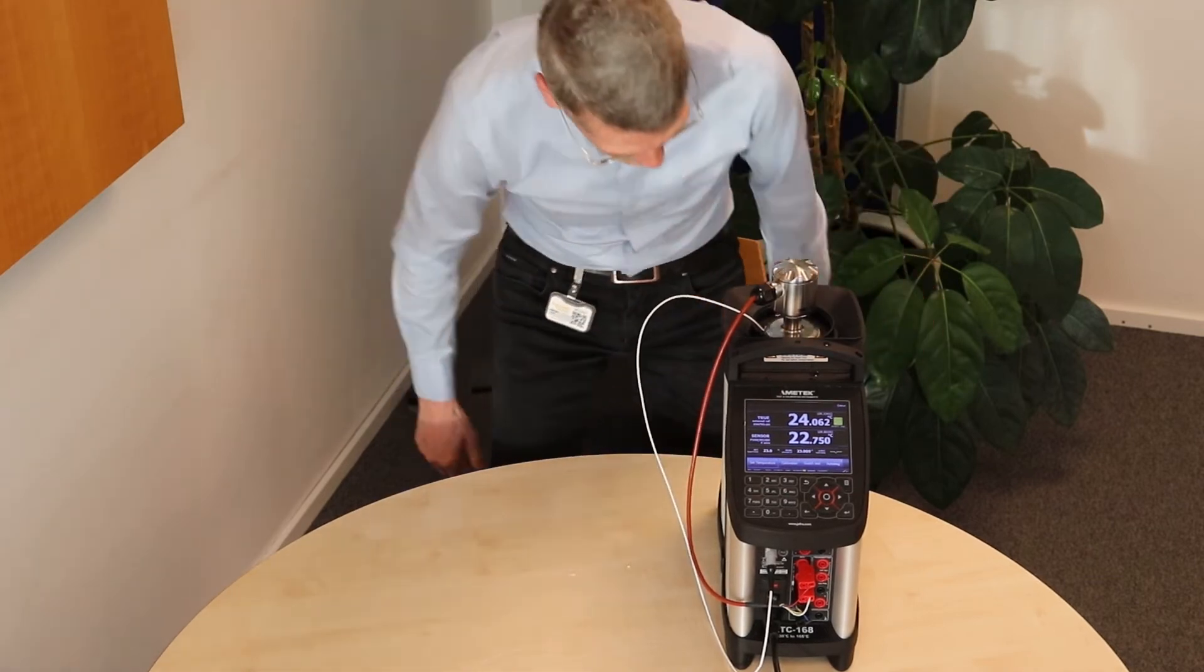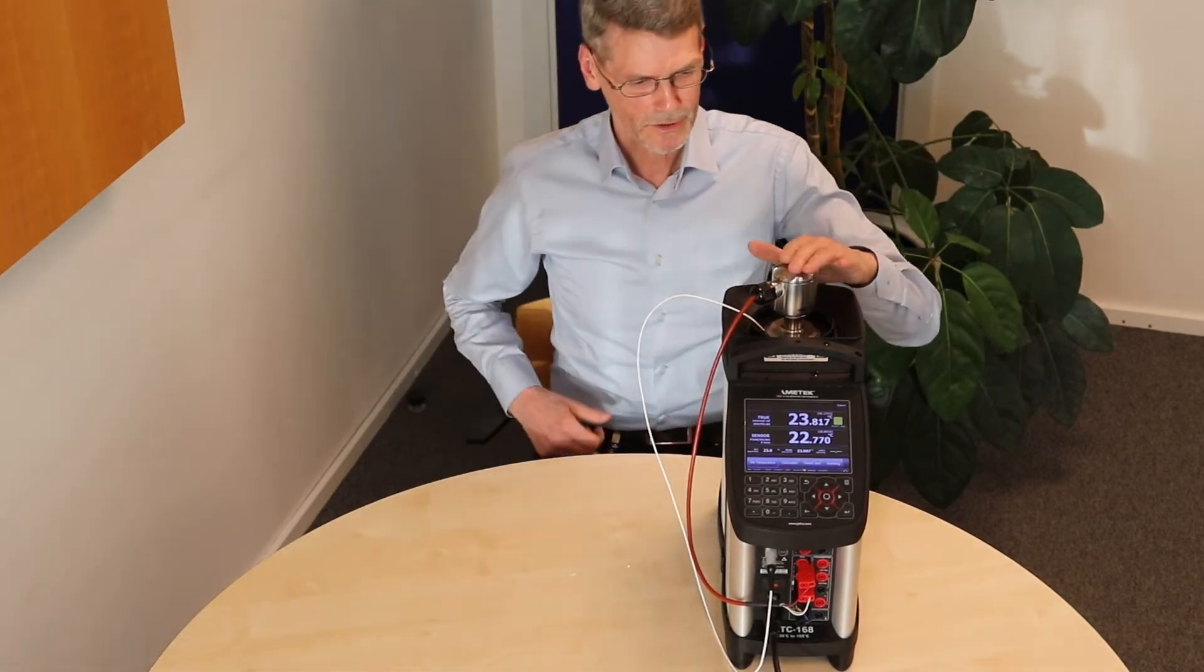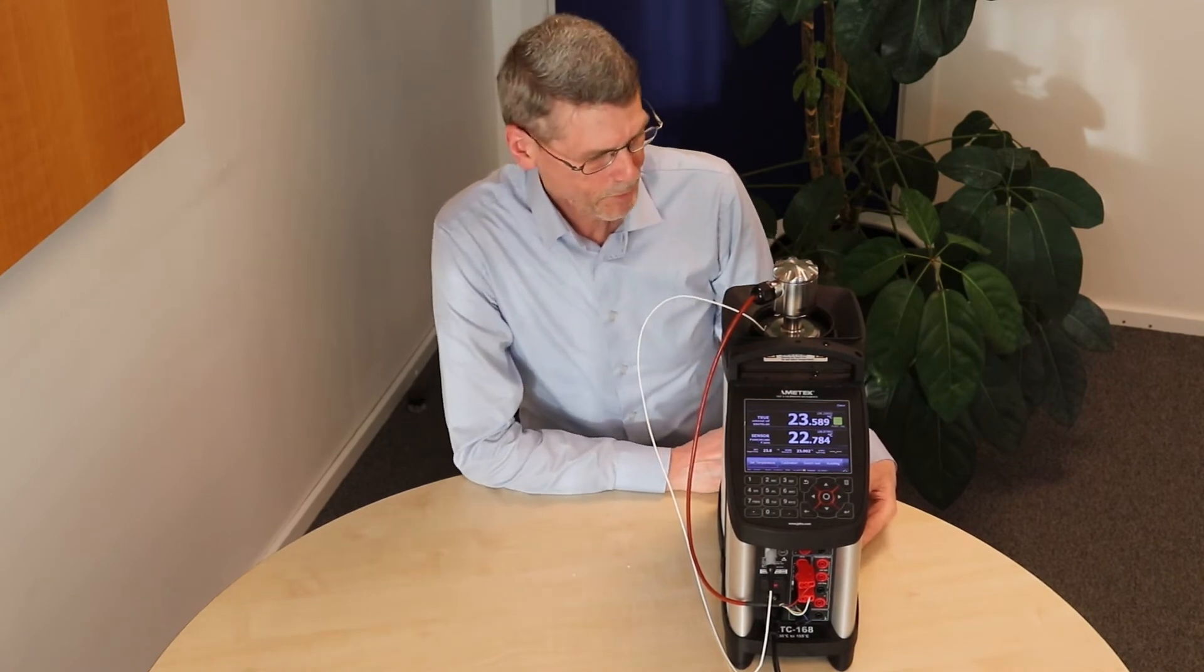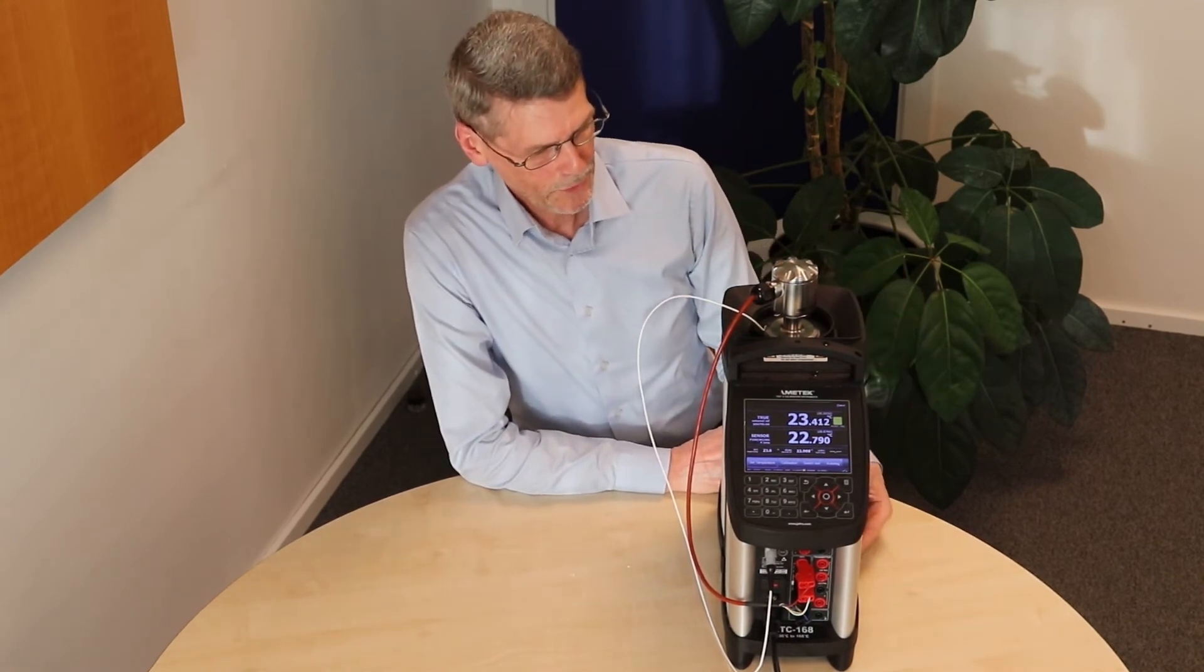With the heat conveyor, you can see that the sensor is in a fixed position, so you have high repeatability when you calibrate next time.